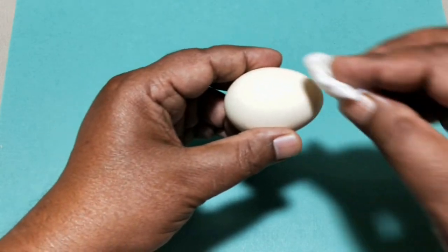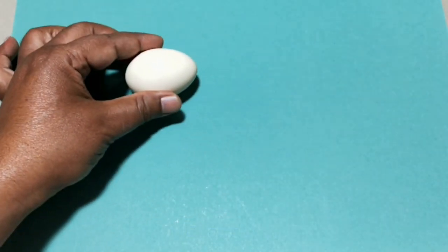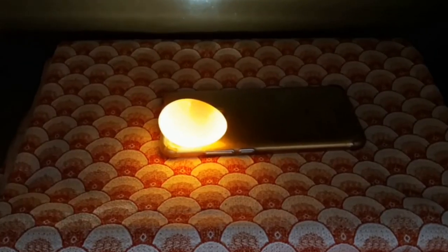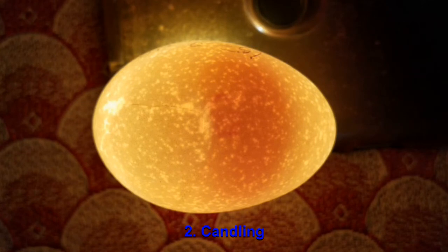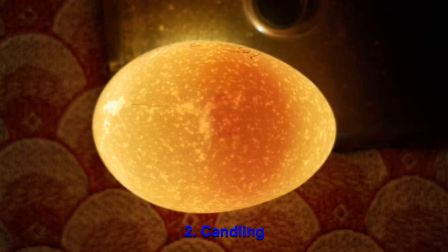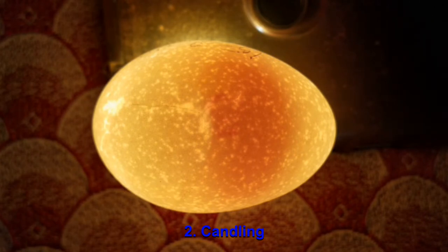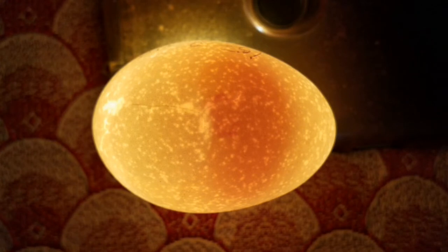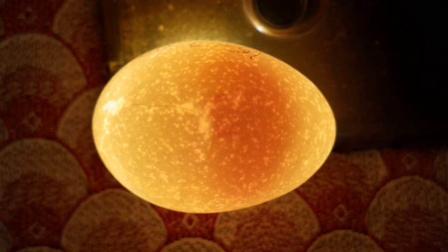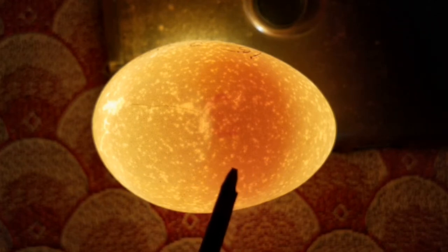Now, we shall begin the technique. Collect an egg and clean it with wet cotton. By doing candling, confirm the presence of the developing embryo. Candling is a method to study the growth and development of an embryo inside an egg using a bright light source behind the egg. Keep the egg on a cell phone torch light in a dark place, like inside of an almirah, and confirm. You can see here — this is the developing embryo.